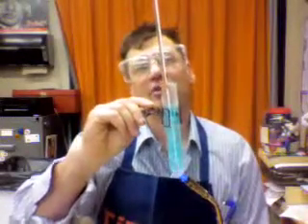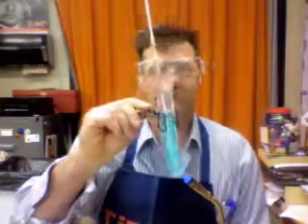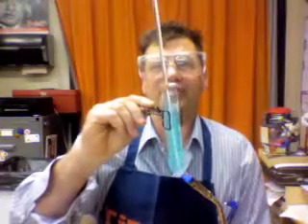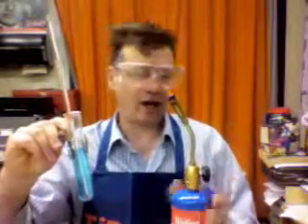And the temperature on the thermometer reads, oh my gosh, 100 degrees Celsius. I wonder what this substance could be. Look at that, it's holding steady at 100. I wonder what that means. Well, I'm going to take the heat source off before I get splattered with hot boiling liquids.